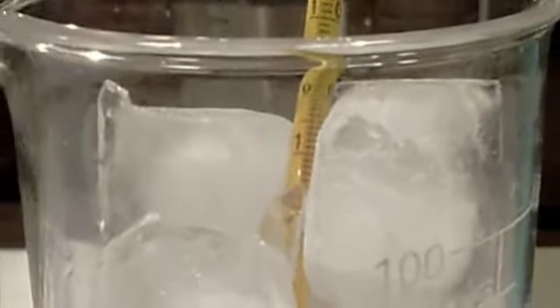So start with minute 0. Minute 0. Right now I'm going to help you because you're not used to reading negative numbers. It is negative 1 degrees Celsius. So for 0 minutes, negative 1 degrees Celsius. Now I'm going to turn on my hot plate. I'm going to let it warm up, and I'm going to come back in exactly 1 minute.